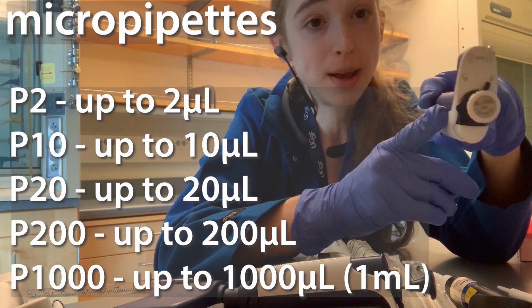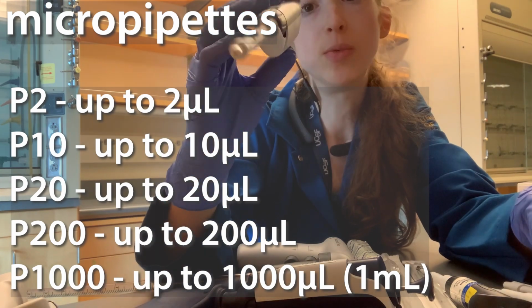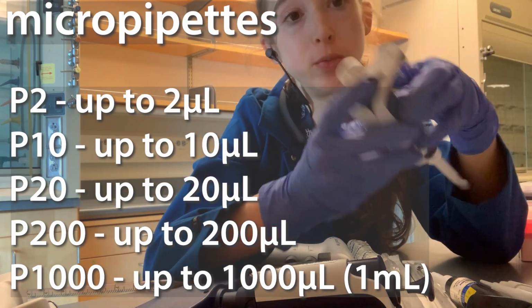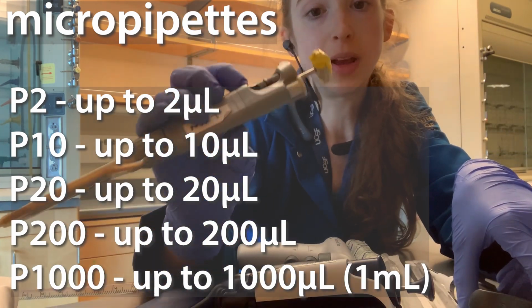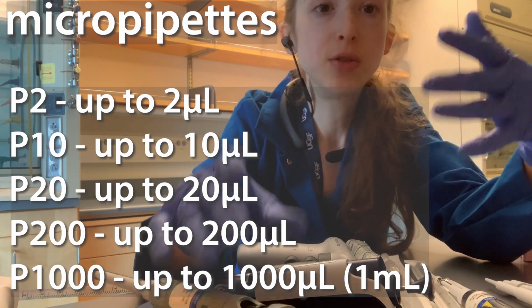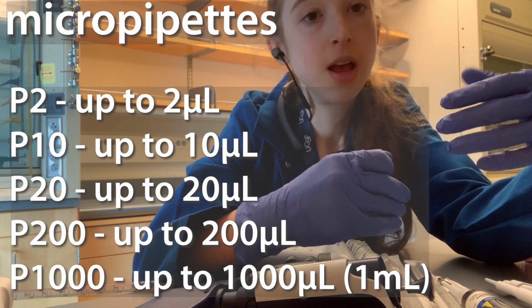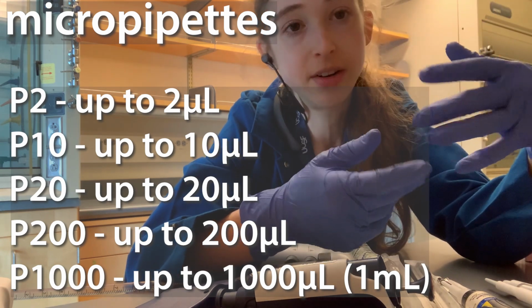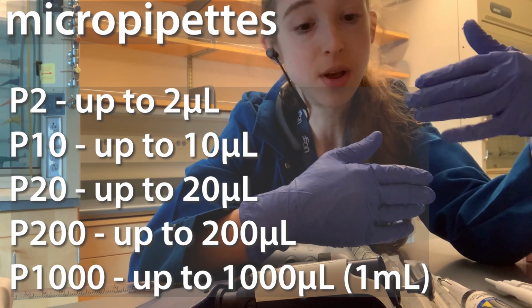But if you wanted to pipette 100 microliters, you'd be much better off using the P100 or the P200, which goes up to 200 microliters and between 20 and 200. And if you wanted to do 20, then you could do a P20. And if you wanted to do 10, you could do a P10, etc. And you always want to use the smallest one for a variety of reasons. It's going to be the most accurate. Basically, it'll be the most accurate, and you'll have the least loss and various things like that. So you always want to use the smallest volume.